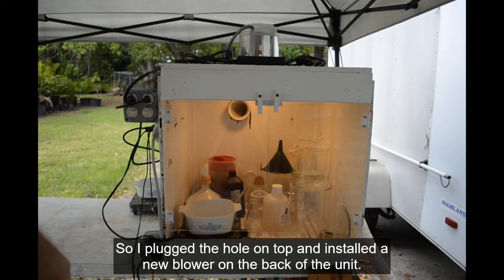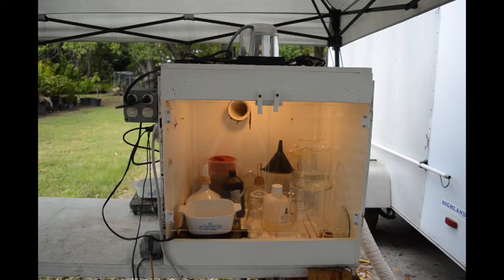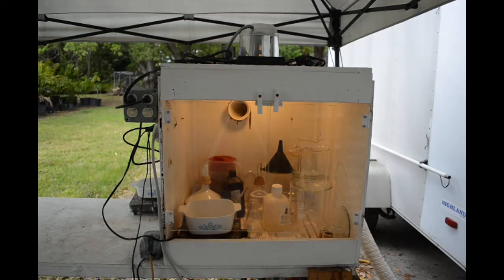I quickly came to the realization that I couldn't use that kind of fan and it shouldn't be mounted up on top where condensate can drip down. So now there's a hole in the back there that leads out to the fan I'm using now, which is a bilge blower - sealed bilge blower, explosion proof.